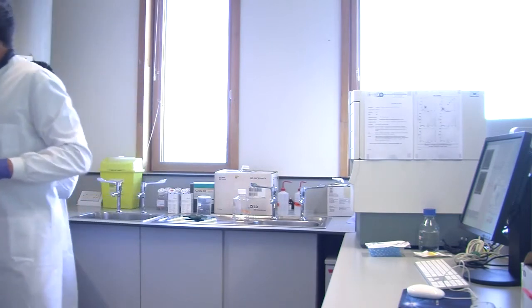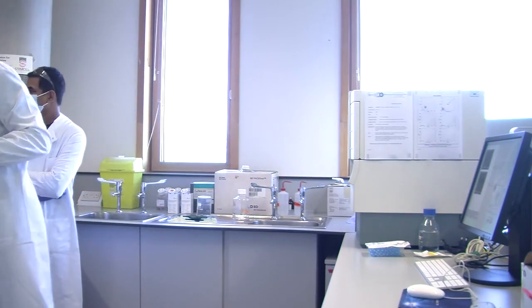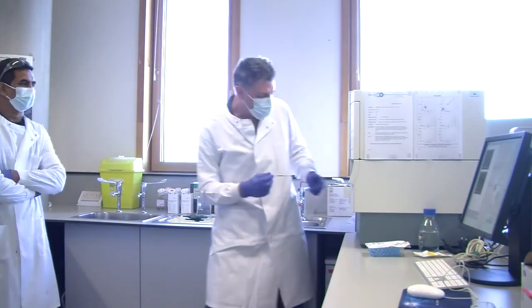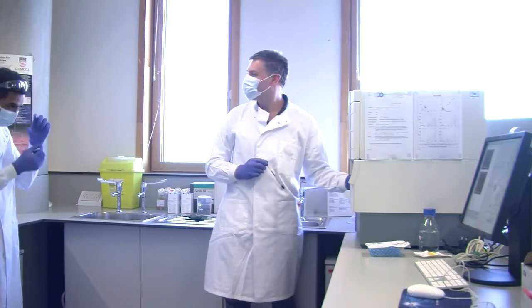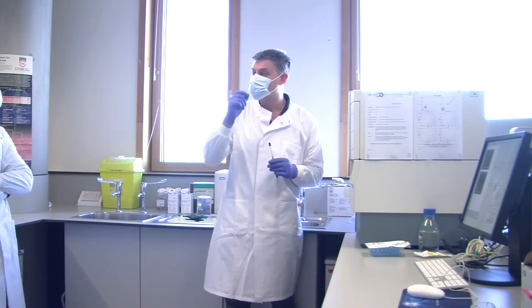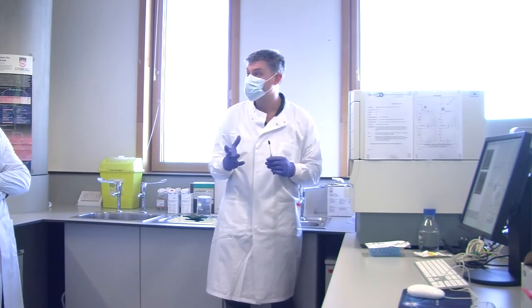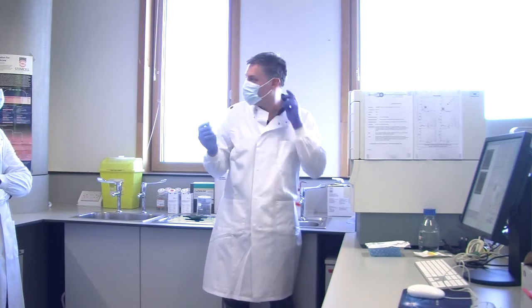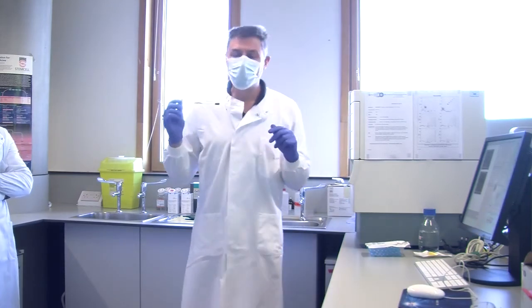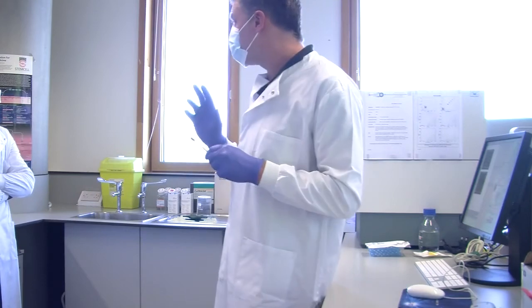You might just about be able to see them in there. What you have to do is feed one of those up the middle of this metal and then into the flow cell to physically clear the blockage. It's not an easy job. It's not the sort of job that I want to be doing. So when you resuspend your cells, make sure you resuspend them properly.